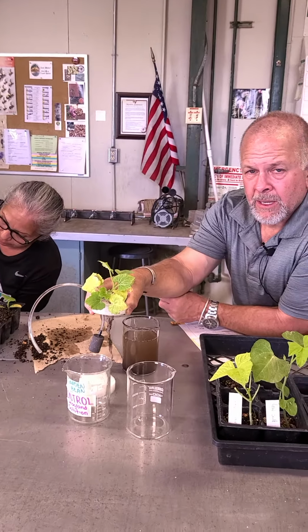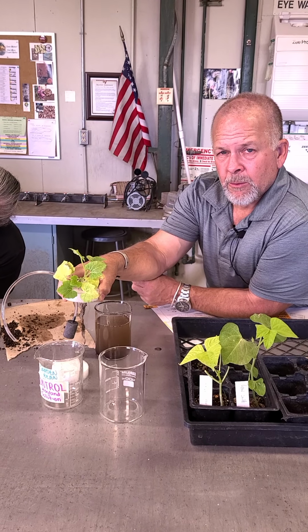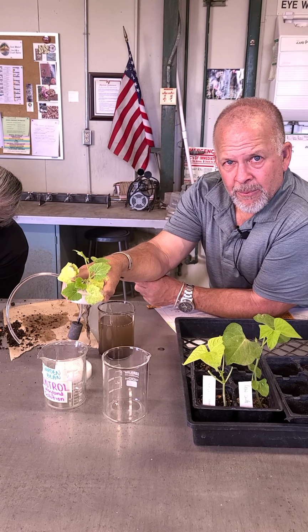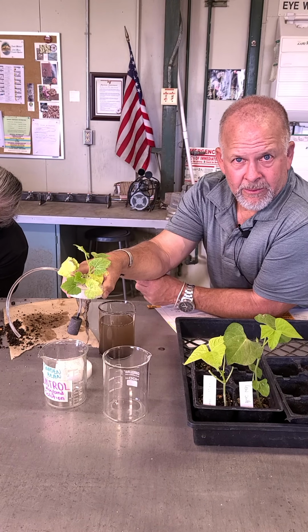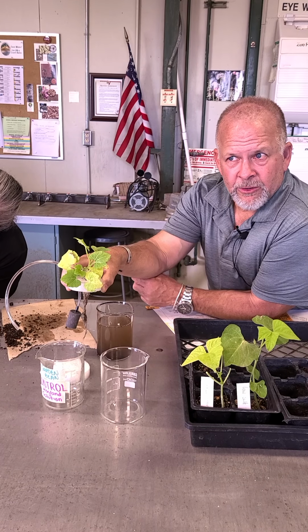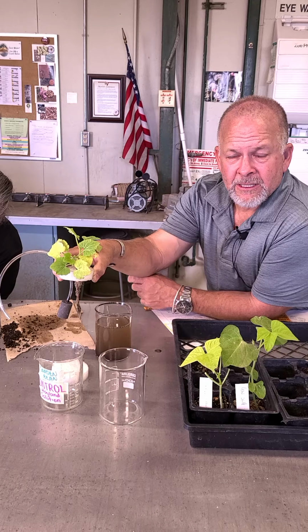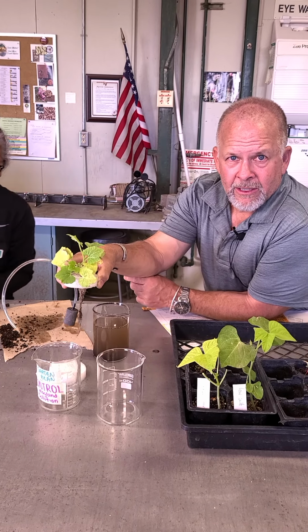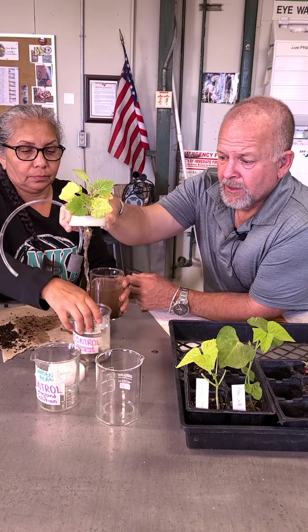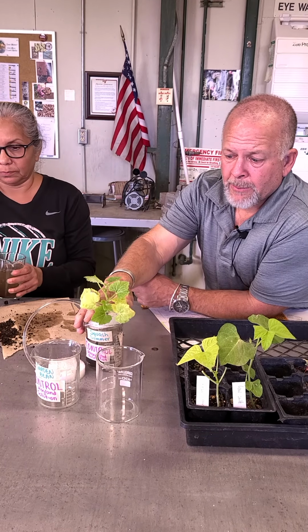And we're gonna maintain these and watch these every couple of days, and we'll fill them back up with the appropriate treatment if they evaporate or the plant uses the liquid and transpires it. We'll make sure that they're filled up. But it really doesn't matter that they have the exact same amount. What matters is that they don't dry out, that they have enough liquid to be able to grow in an optimum fashion.